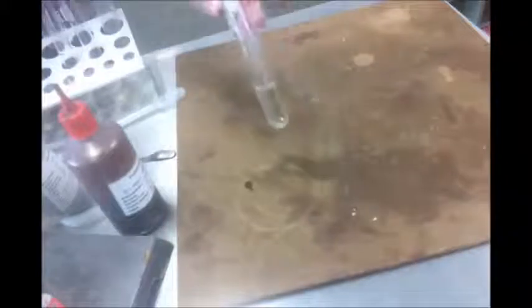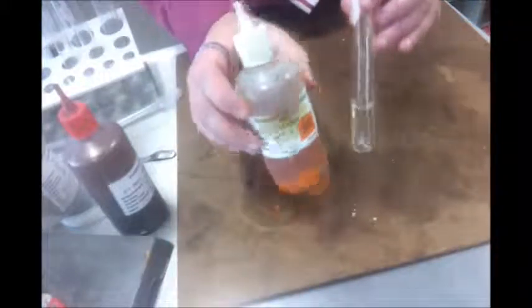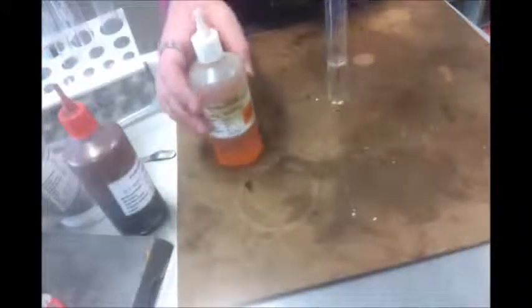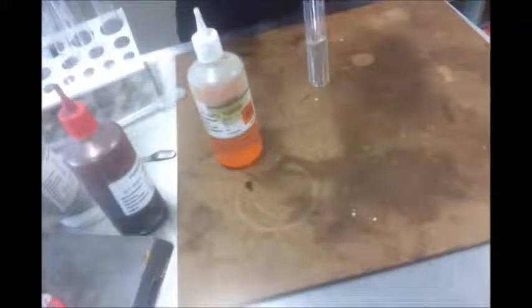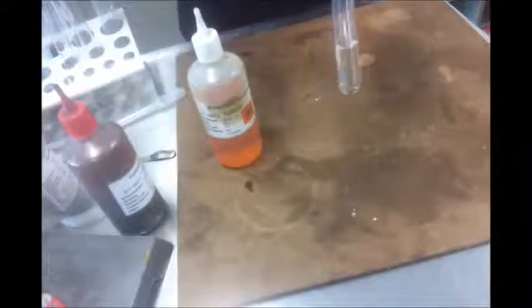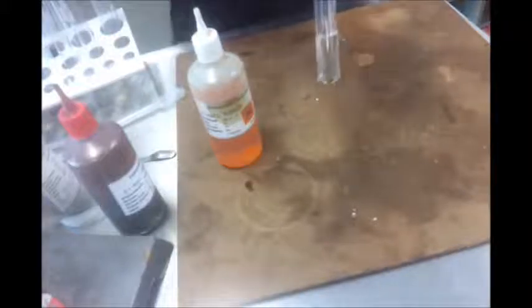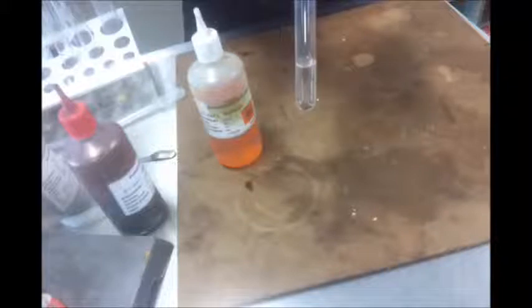And then I'm going to add this orange stuff called potassium dichromate. Now, this has got a nice skull and crossbones for a reason. It's got a form of chromium called chromium 6 or hexavalent chromium. If any of you have seen the film Erin Brockovich, the company that's made out to be evil, it's talking about how chromium is actually really good for us and we need it in our diet and all that sort of thing, and so it being in the soil is not a problem.